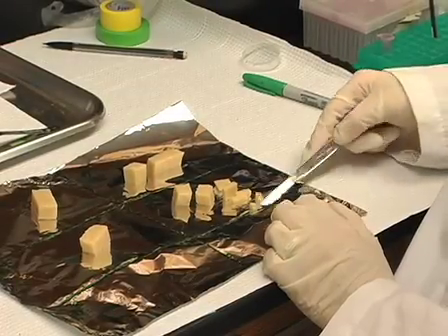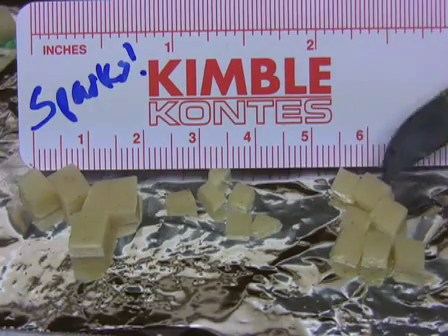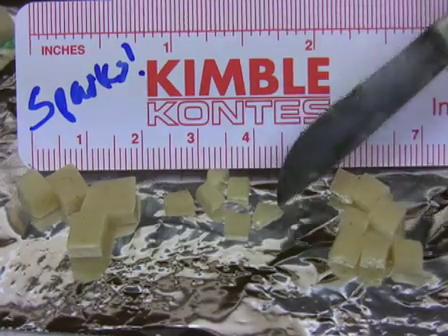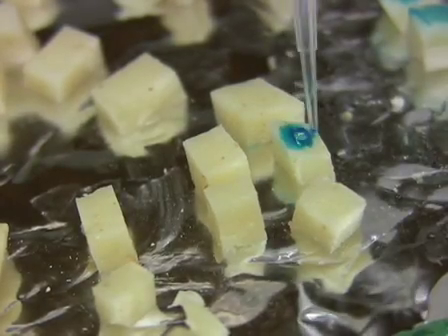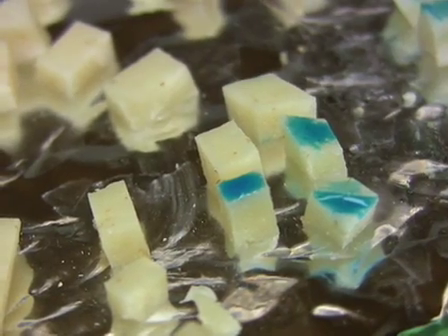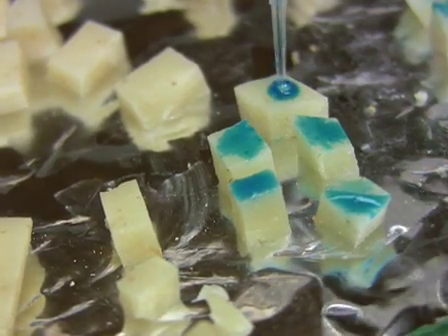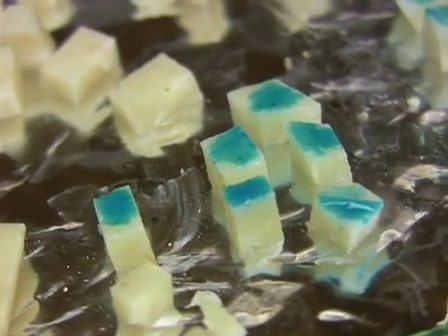The next day, prepare the diet by cutting it into small cubes, about 2 cubic millimeters. If the diet cubes are too small, they will dry out. If the diet cubes are too large, the larvae will not be able to consume the entire diet cube overnight. Now add 1 to 2 microliters of polyhedra suspension to each diet cube. The suspension contains 4% by volume food coloring dye. Let the suspension soak into the diet for 5 to 15 minutes. Remember to also prepare a mock virus-treated diet cube as a negative control.